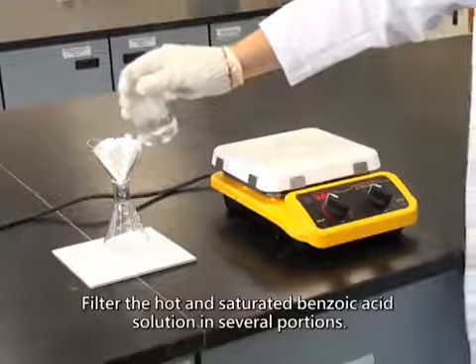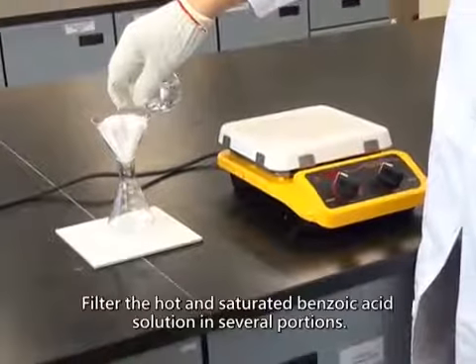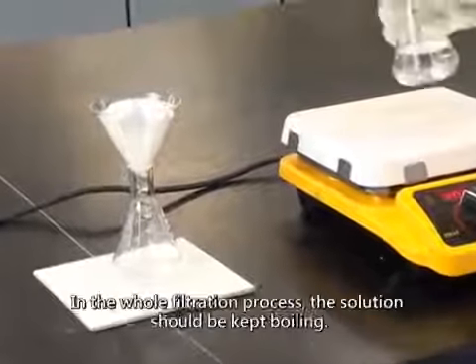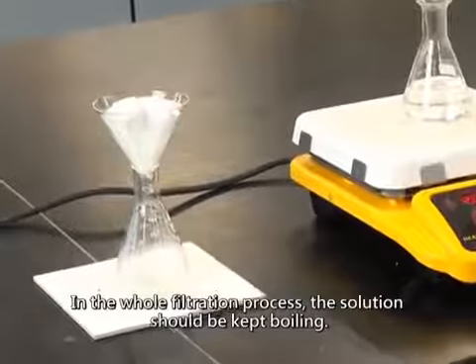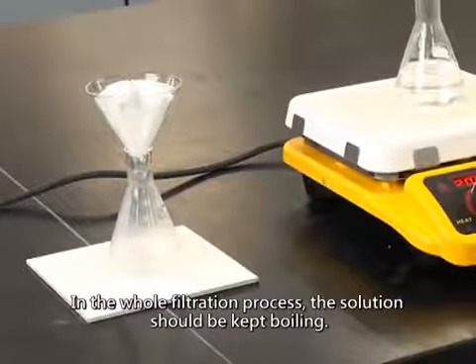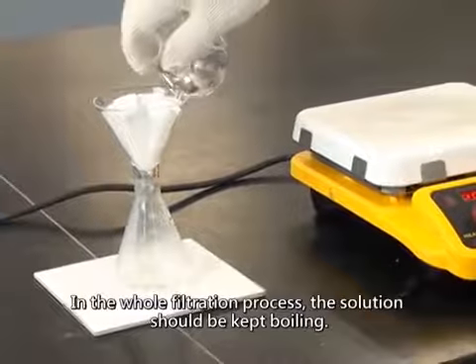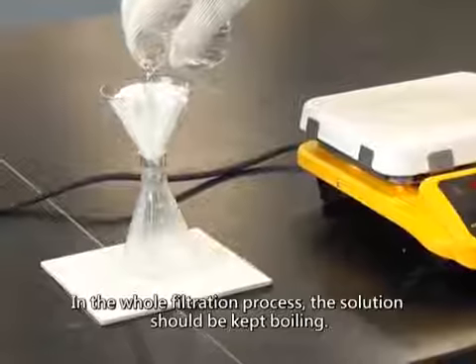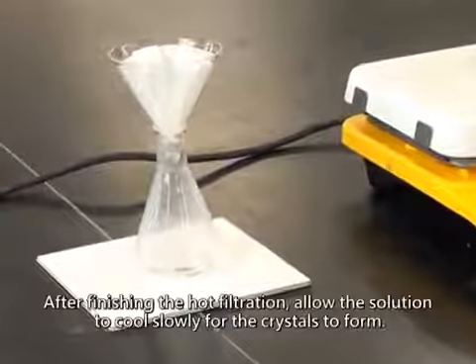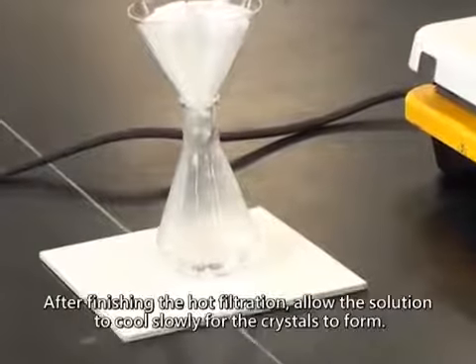Filter the hot and saturated benzoic acid solution in several portions. In the whole filtration process, the solution should be kept boiling. After finishing the hot filtration, allow the solution to cool slowly for the crystals to form.